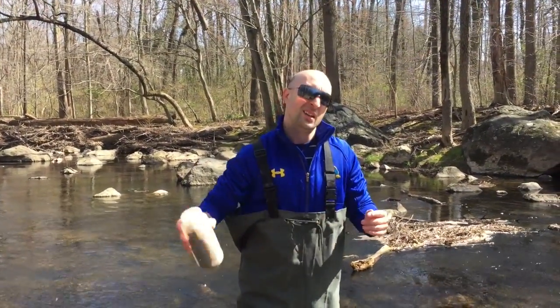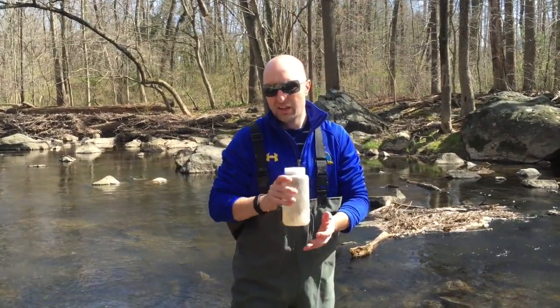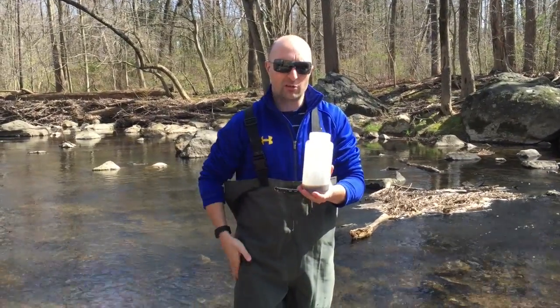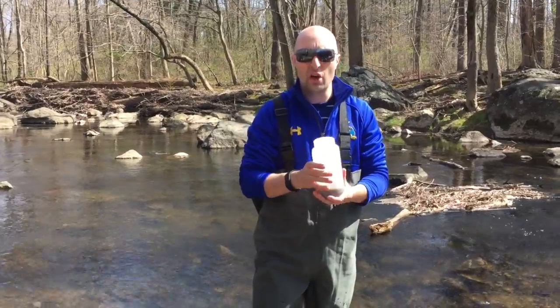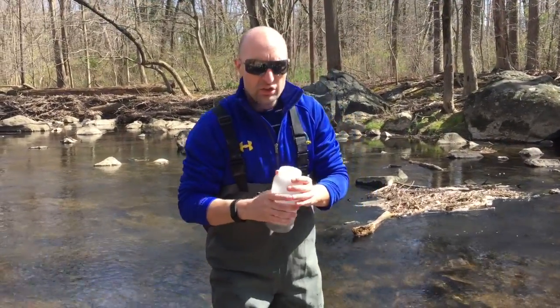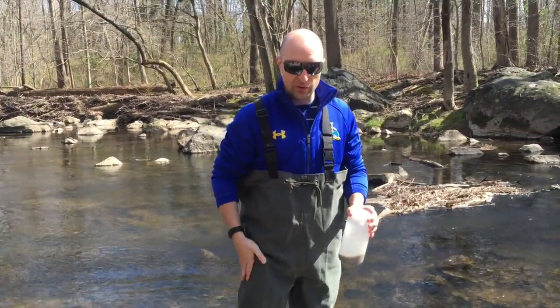Cap the composite bottle and shake it. The algae are actually attached to the individual sand grains, and the shaking is going to dislodge them into the supernatant above. You'll want to do this at several locations — several rocks or several pieces of sand — at your site.